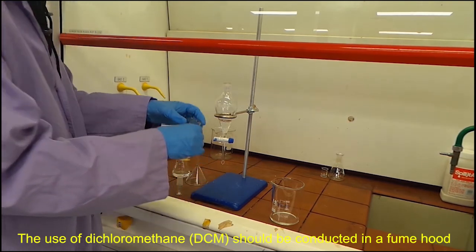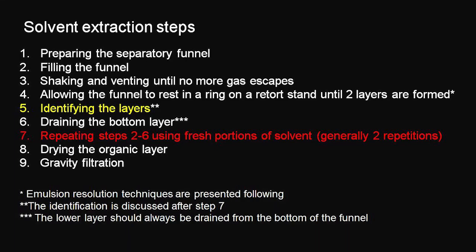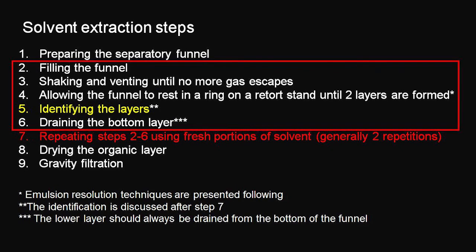The remaining liquid is raffinate. The extraction steps can be repeated twice or more times with fresh solvent to ensure complete extraction.